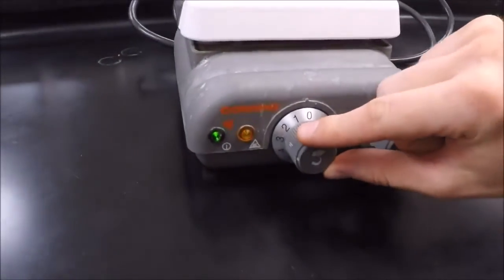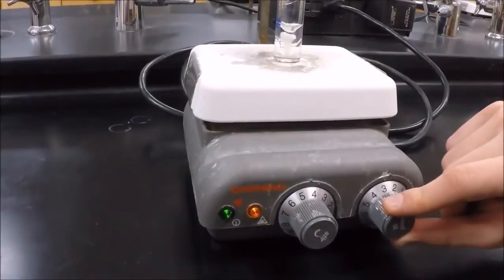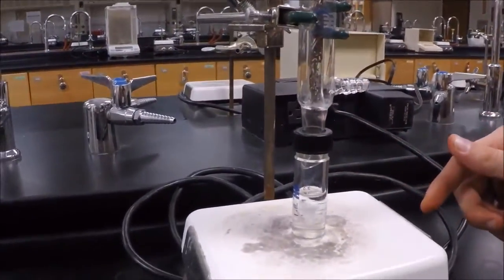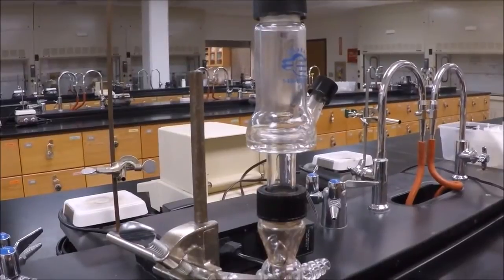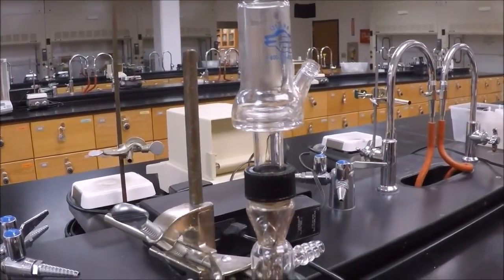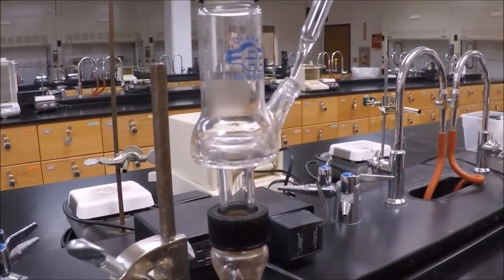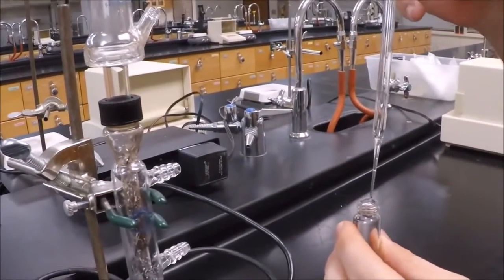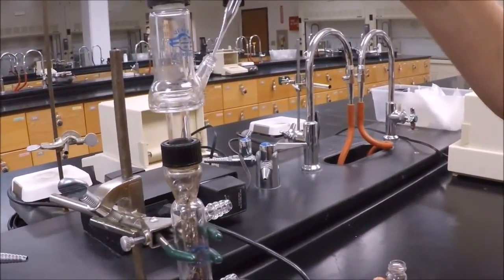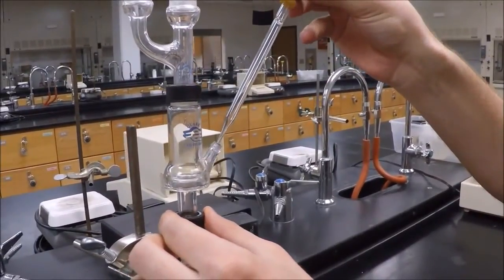We're going to do the same thing we did with our simple distillation: turn on the stir bar and turn on the heat to about 4 or 5. Make sure the conical vial is touching the hot plate. Just like with the simple distillation, we're going to collect our distillate in the well of the Hickman still. Again, this should be pure hexane. Deposit it into the vial and get as much as possible so you don't have any mixture with your toluene.